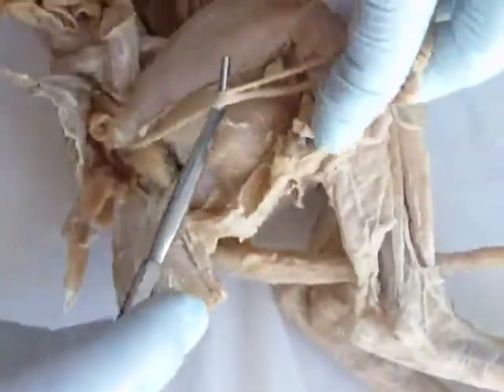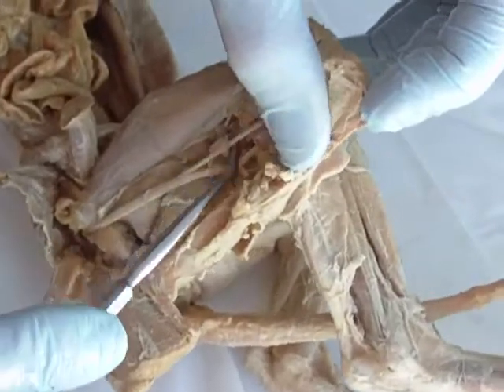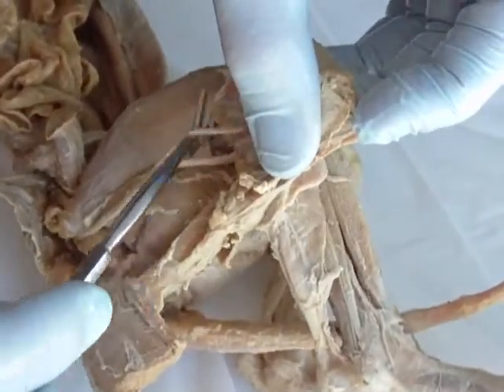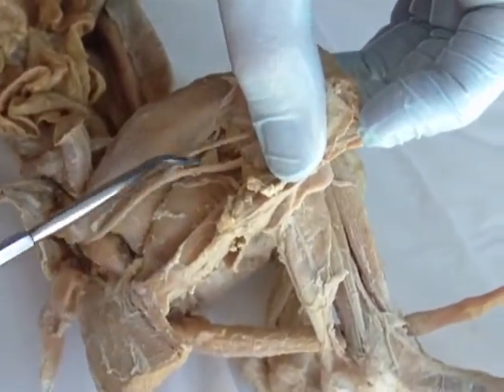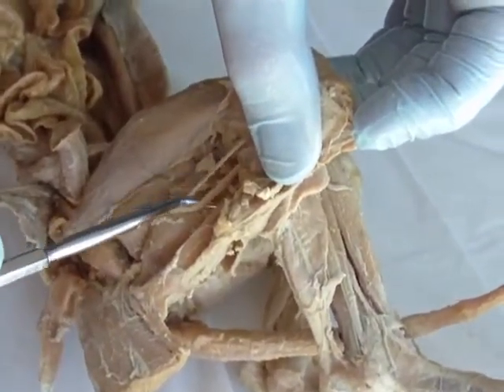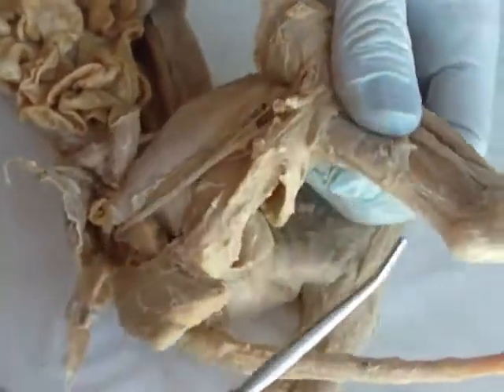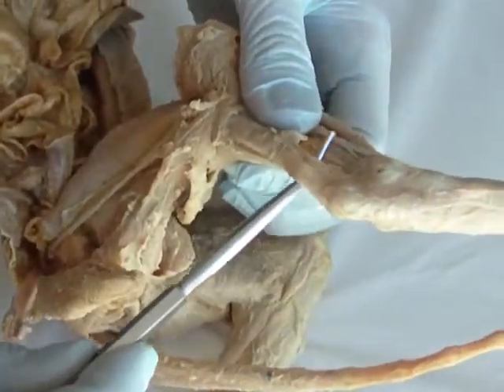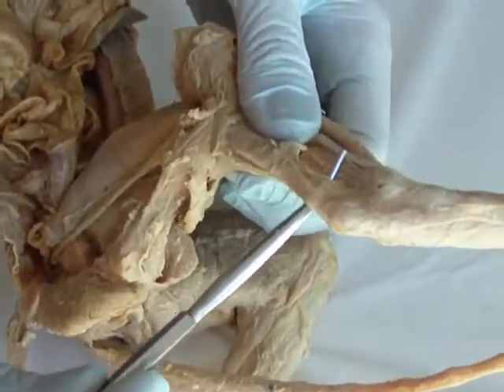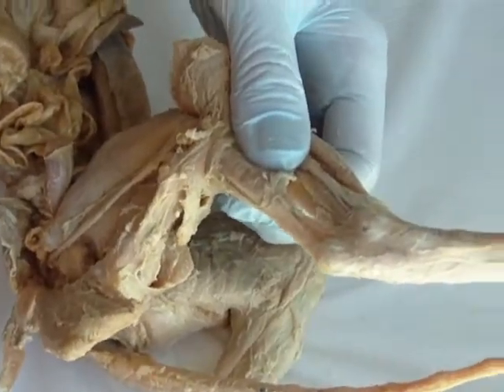You have your sciatic nerve, which branches off into two pieces. The upper piece is your peroneal branch, and the lower branch is your tibial branch. And back here you have your Achilles tendon. And that's it.